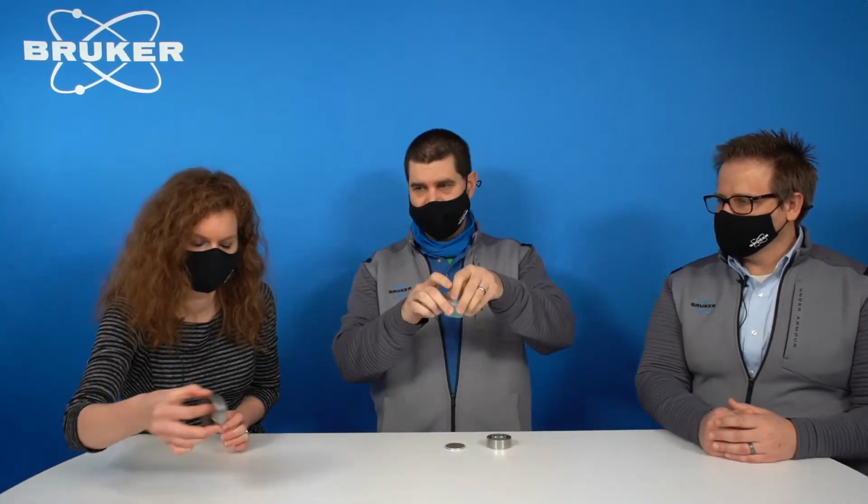Correct. So the next question from Nick, what type of samples can we measure with the S6 JAGUAR? Sure, I'll take that one. Thanks, Nick, for your question. So we can run all different types of samples in our instrument. So if you want to start with a powder sample and run that with a liquid cup, you could. You could add a binder to that, and you can press it into a pellet if you want to. Do we have a pellet here? Yep. So here's an example of a pellet. And then if you want, you can fuse the sample into a glass bead. You could also run the sample as a liquid that we see here in a liquid cup. Oh, here we go. Here's a fused bead right there. You have everything for us.